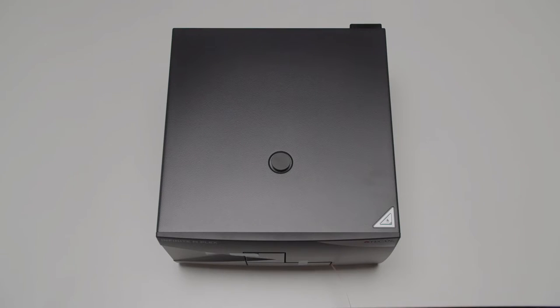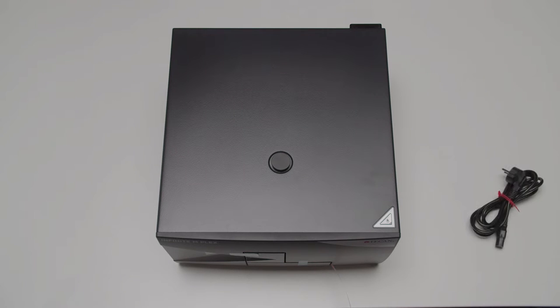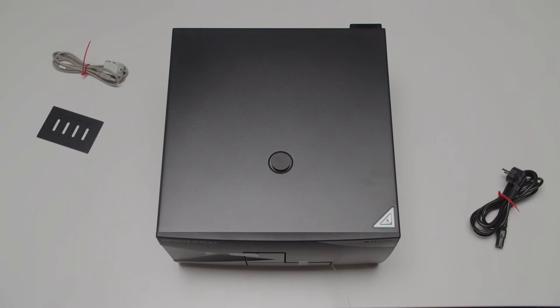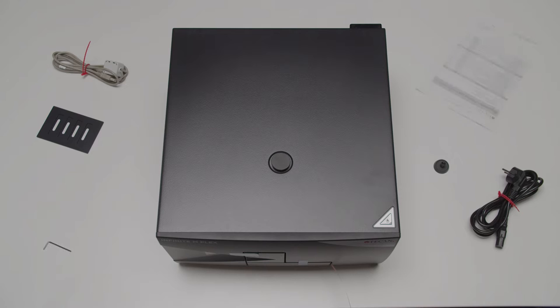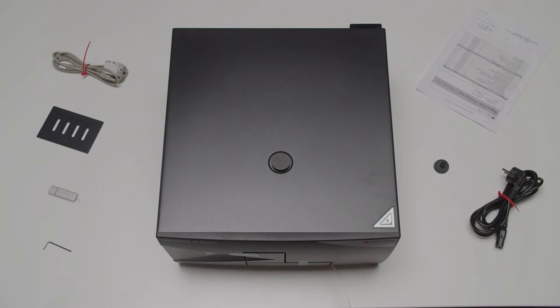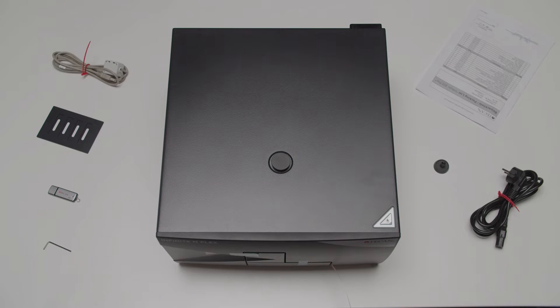The additional package includes power cable, USB cable, cuvette adapter, injector dummy, an allen key and relevant product documentation. The USB stick contains the iControl software and further operating instructions.